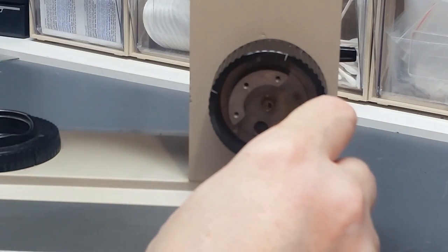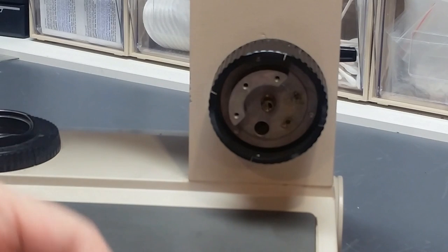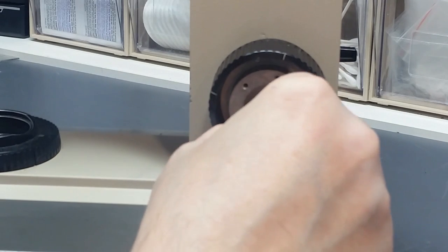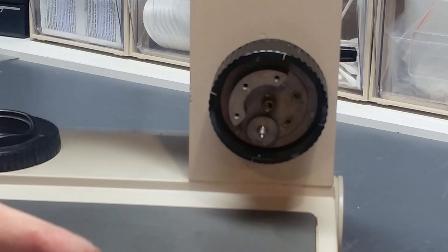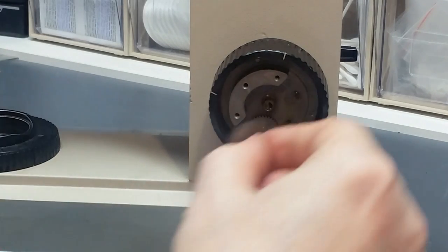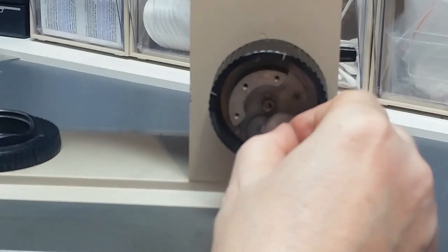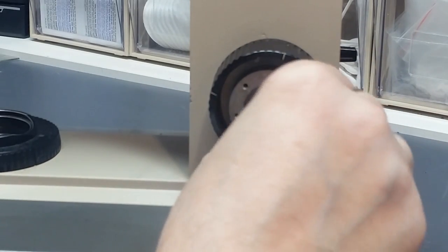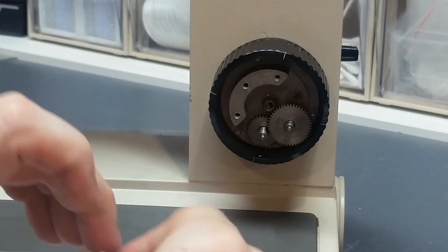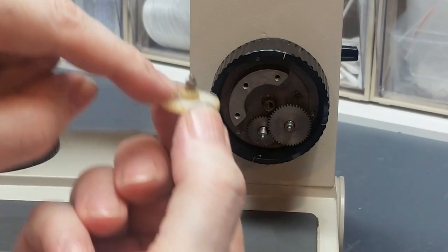Shoot just a little bit of grease into these two holes. I'm going to take this gear here, this is the first gear I put in, put a little bit of grease on this post. Drop this gear into the big hole here. Okay, next is this guy. Even though I've already greased the hole, I'm going to put just a touch of grease on this post. Install it with the little gear side down. Make sure they spin. And the last one to install is this little plastic one. Once again, just a touch of grease on there. Little gear in.